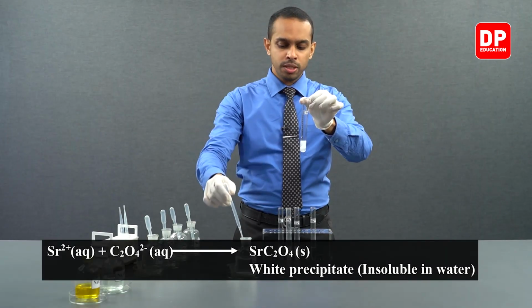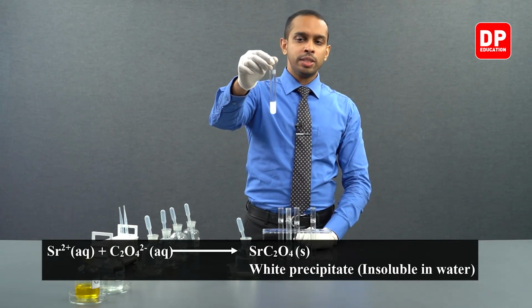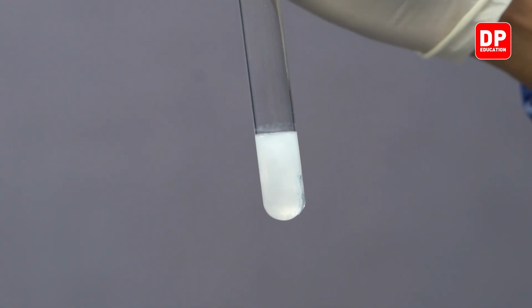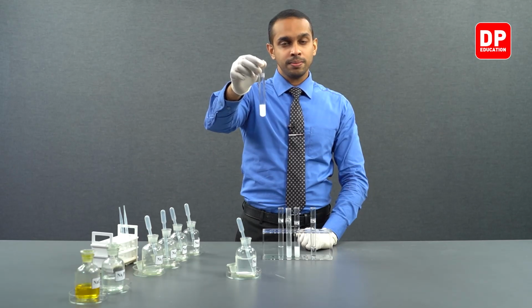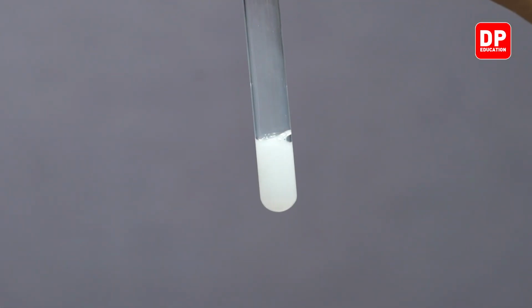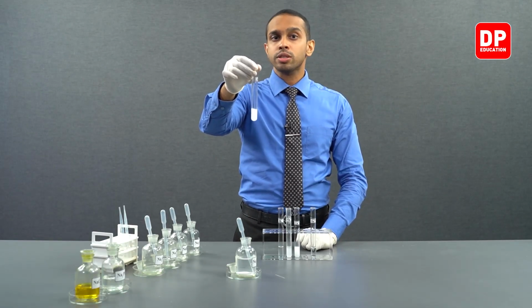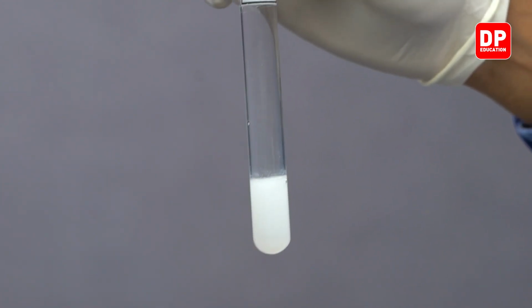Let's add a few more drops. And now you can very clearly see the formation of a white color precipitate when we added oxalate anions to strontium cations. This means strontium 2+ in the presence of oxalate anion forms strontium oxalate, which is a white color precipitate which is insoluble in water.